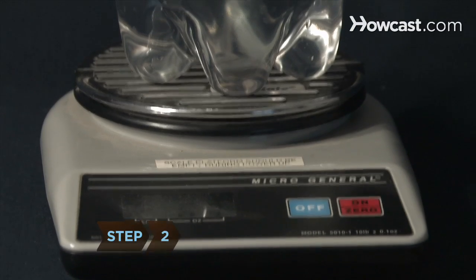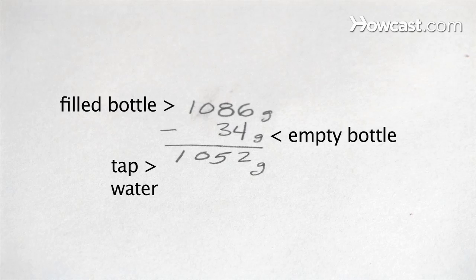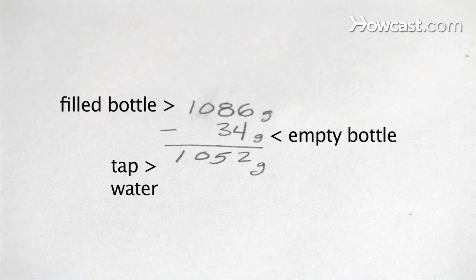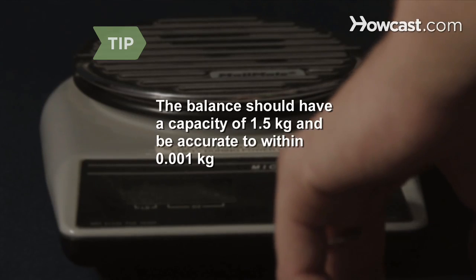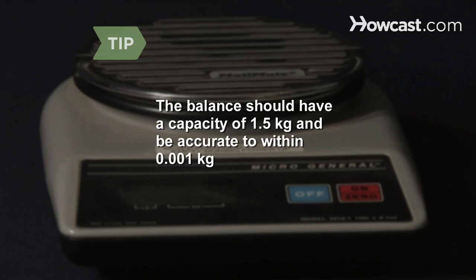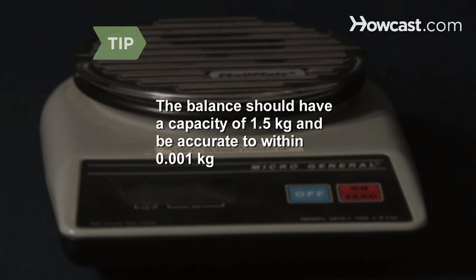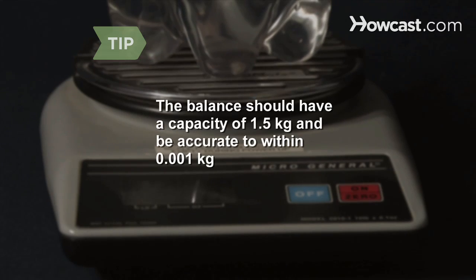Step 2. Weigh the filled bottle on the balance, then subtract the weight of the empty bottle and note the weight of the tap water. The balance should have a capacity of at least 1.5 kg and be accurate to within 0.001 kg.